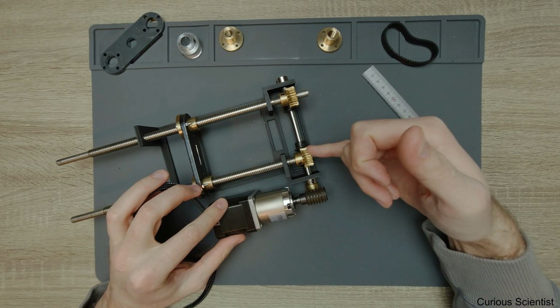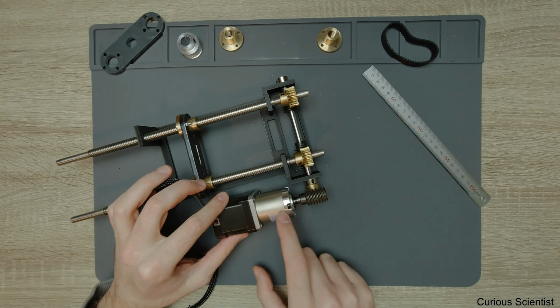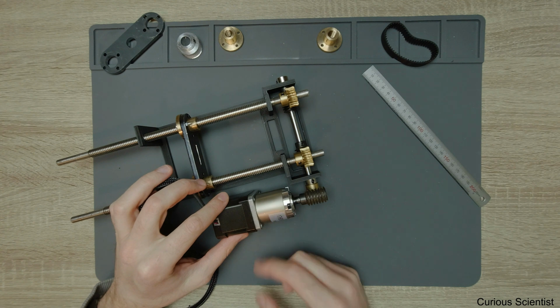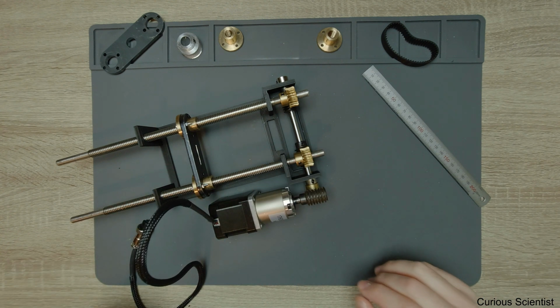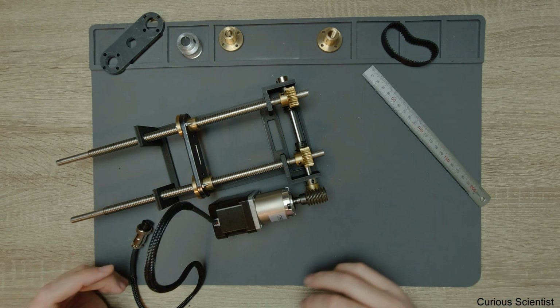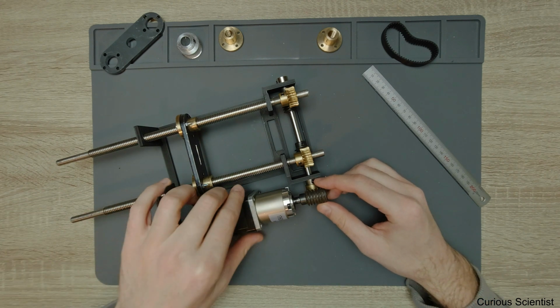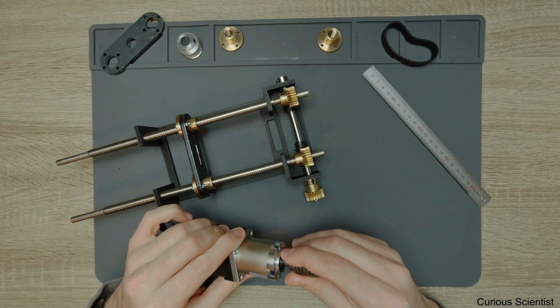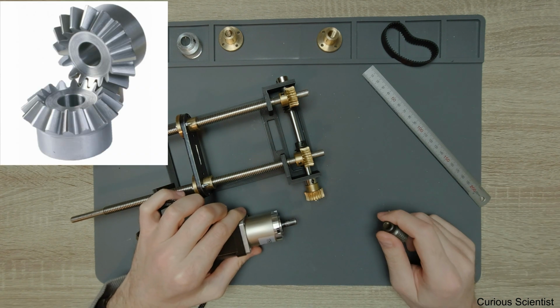And also you do the same here at this part. So you might want to change the planetary gear here to a smaller gear ratio. So at the end you will have the perfect or desired speed and torque. Of course you have to calculate it. Or you can use these conical shaped bevel gears, and then you don't lose any torque.